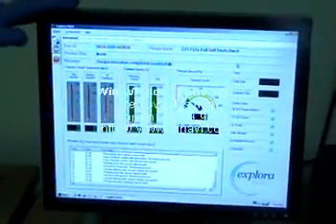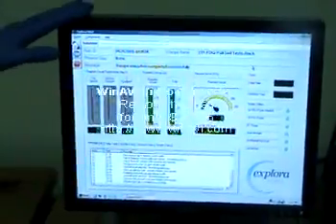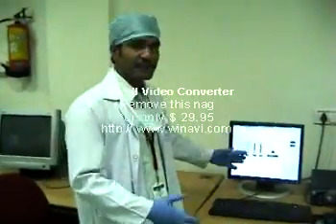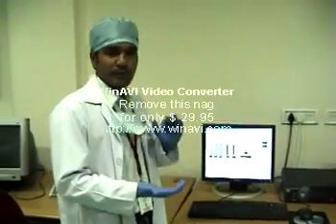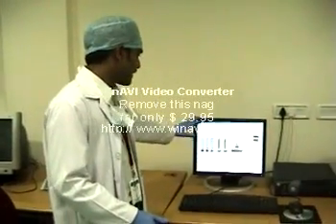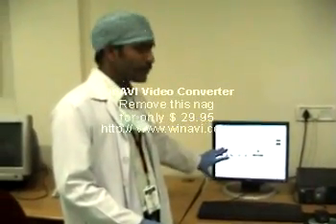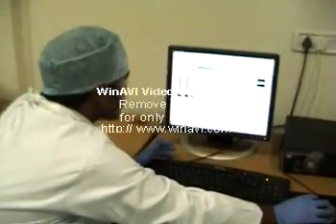This is the system by which we control the synthesis module. Everything is operated by the system. If you want to add reagents or perform any step, we can do it from here. We can write our own protocols, and we can specify what volumes and quantities we need, all from this monitor. I will show you how we synthesize the fluorodeoxyglucose and how this software helps us. We have certain protocols here.